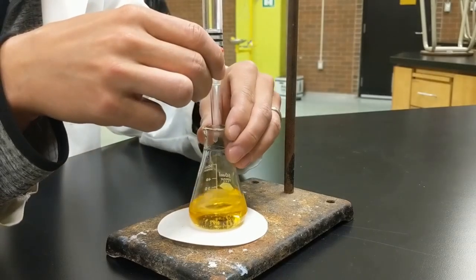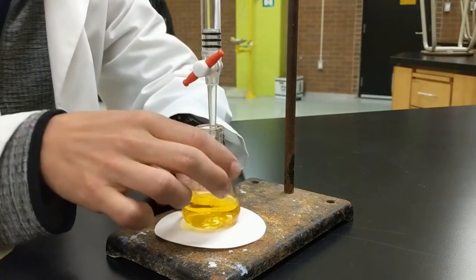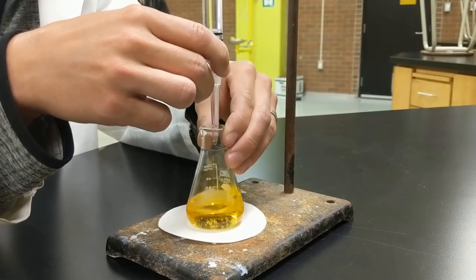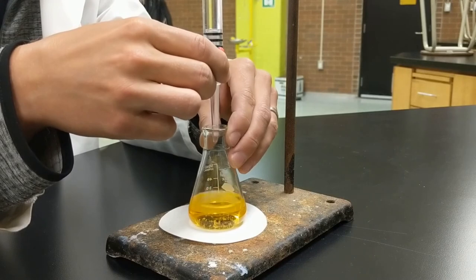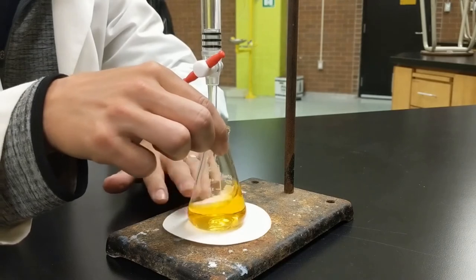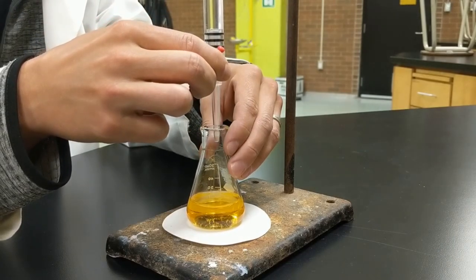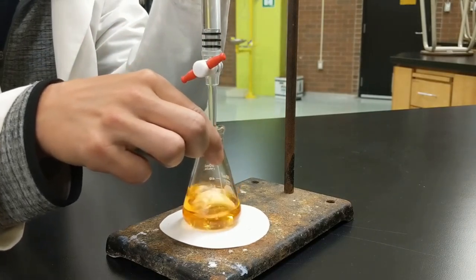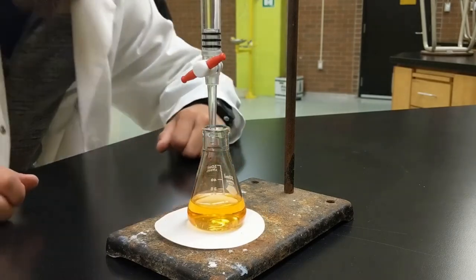We want this to change the entire sample, so we're pretty close. Hopefully I don't turn the tap the wrong way — you always hold your breath here. Even watching this now I'm holding my breath. We're getting close — I went a bit quick there. We'll drop a few more drops in. It's actually going to be hard to see: we're looking for a peach color, and the change isn't super noticeable, but it's bang on — way to go me.